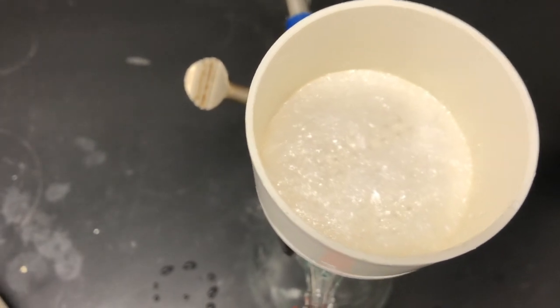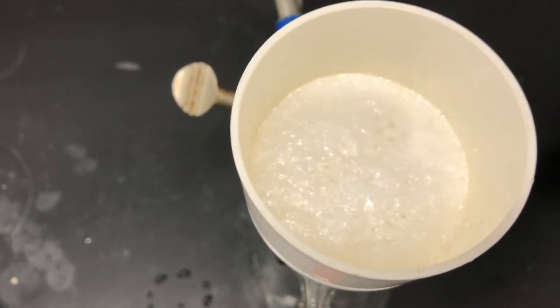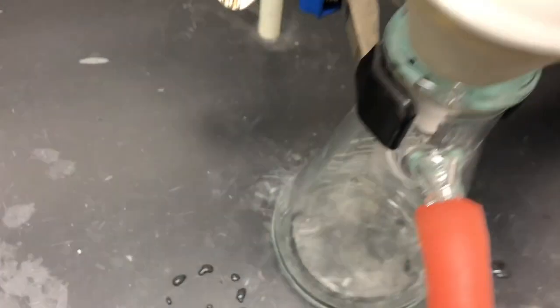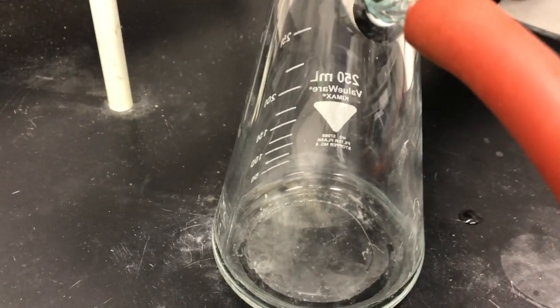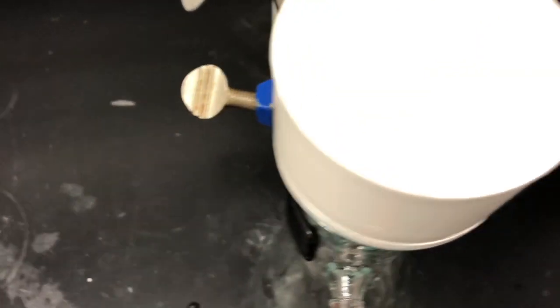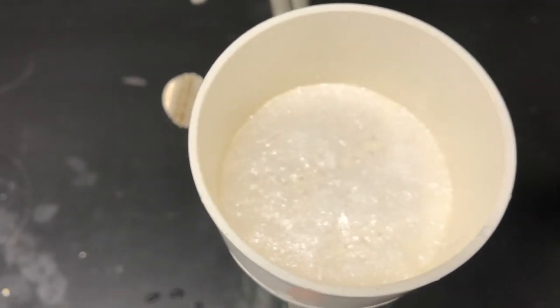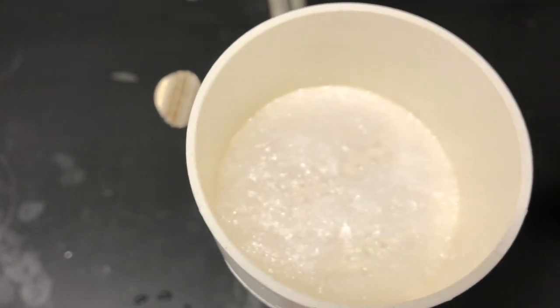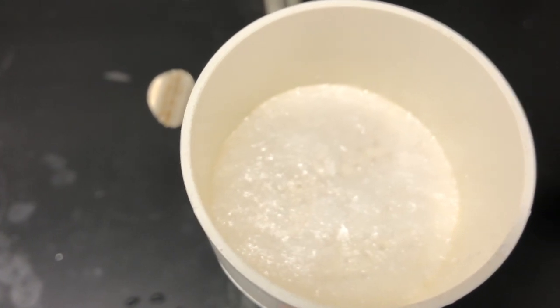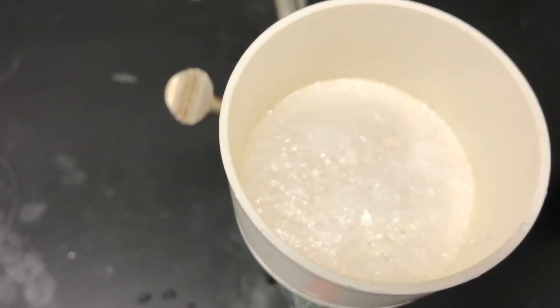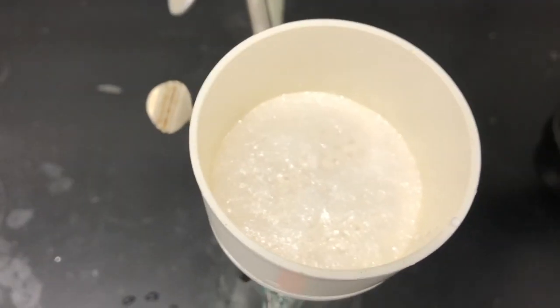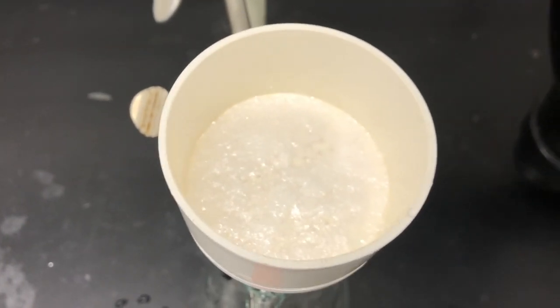Here's a closer look at the crystals of pure NBS, and that's really the filtrate. So we're going to turn off the vacuum in a minute and allow it to air dry for about 15 minutes before taking its weight and determining its melting point to assess its purity.